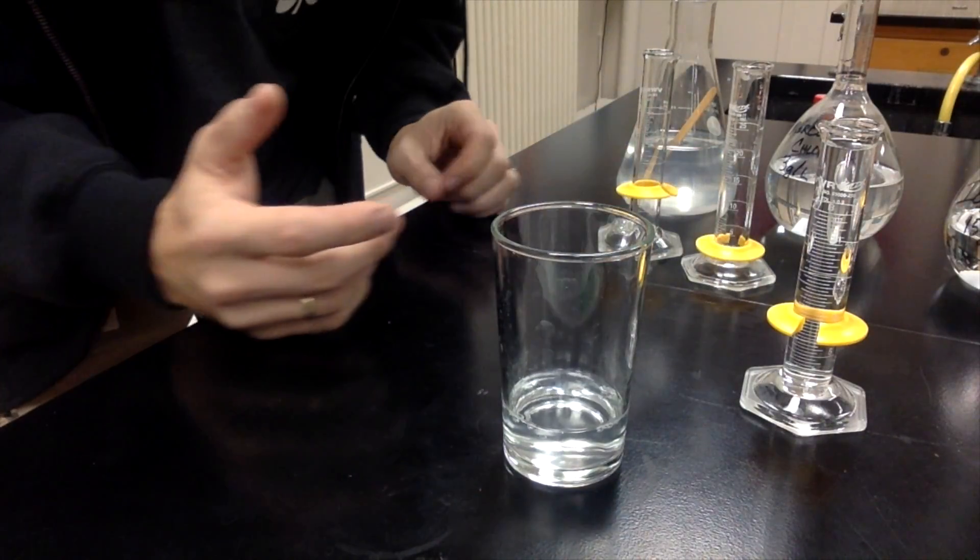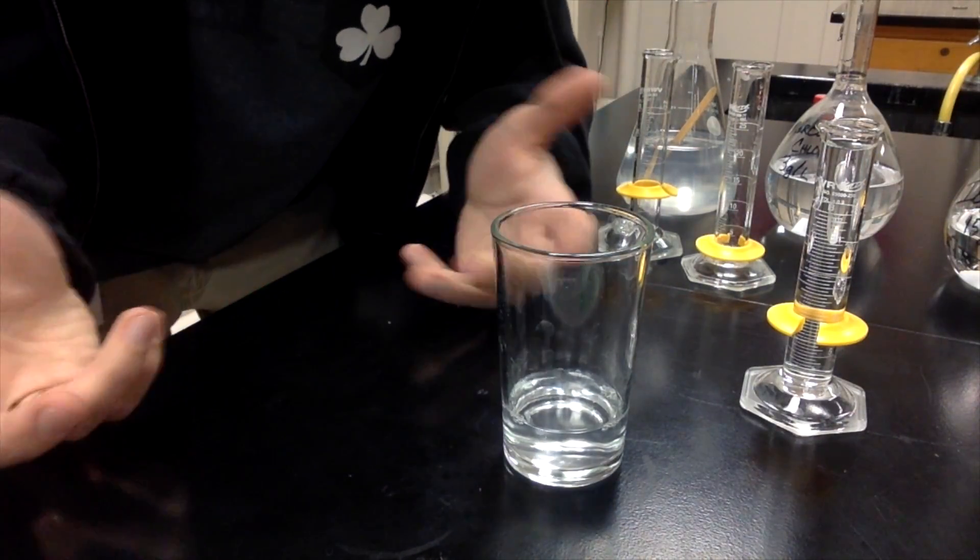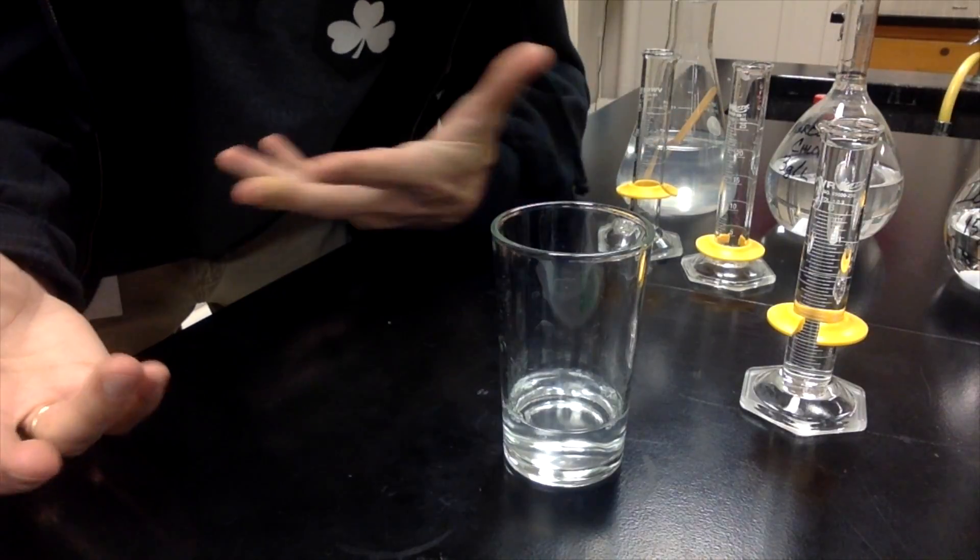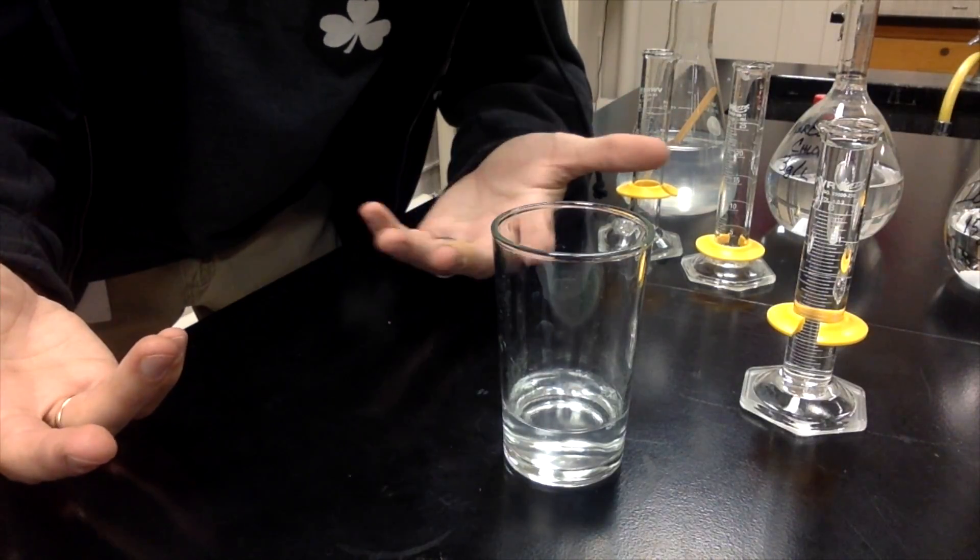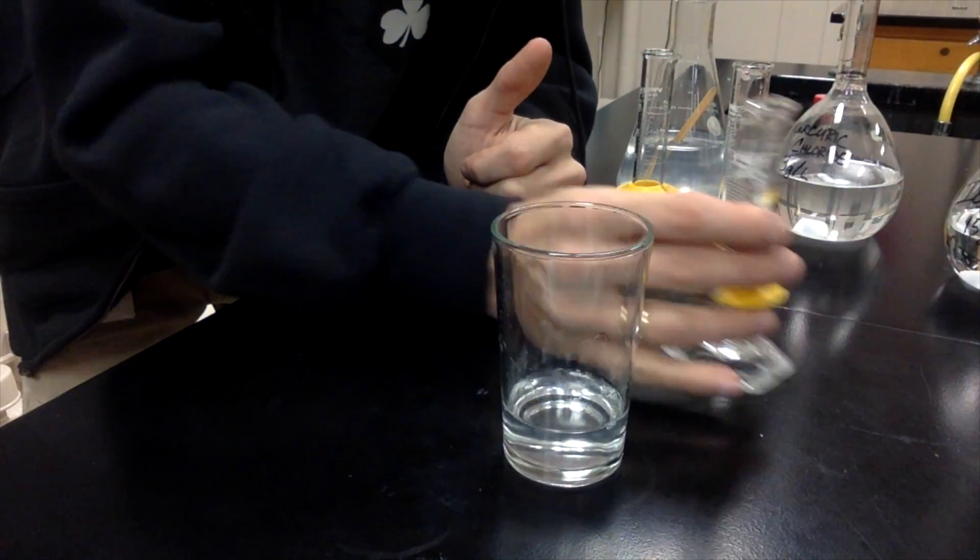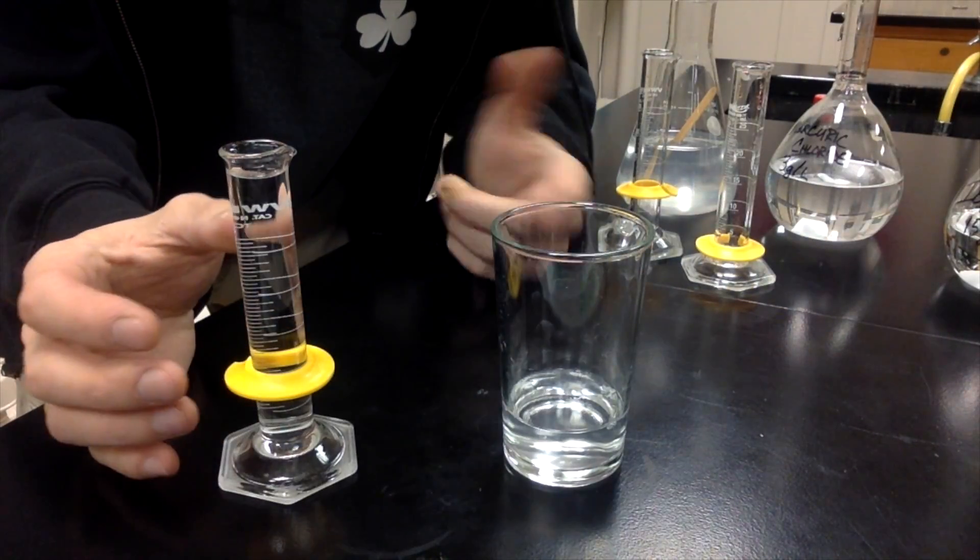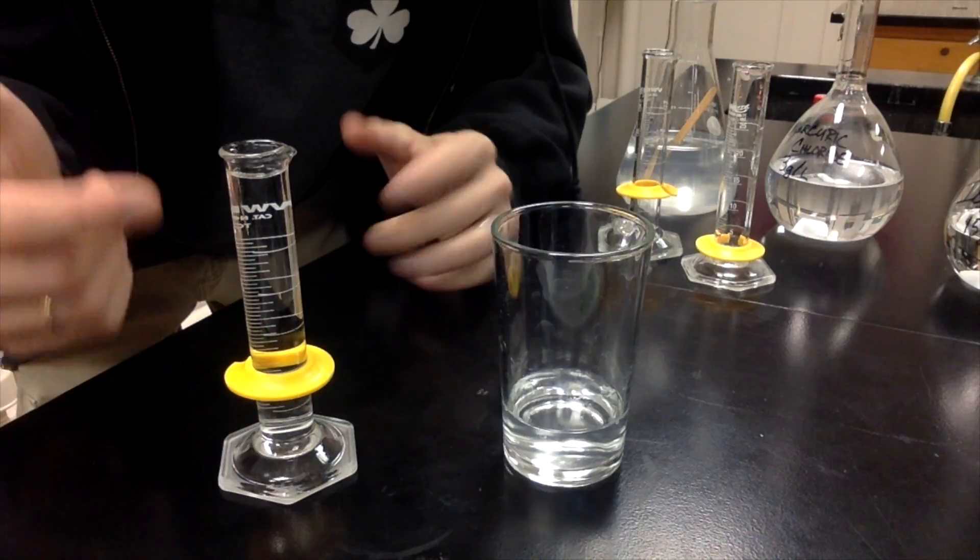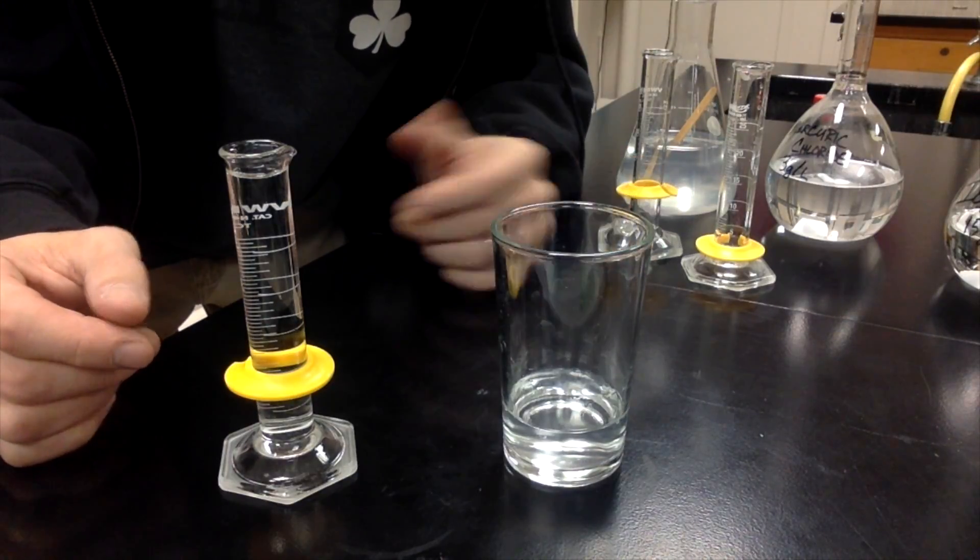I'm just kidding, I like to build a little hype. At this point kids seem to think that stuff's gonna blow up. Anyways, we put it all in there and nothing really happens. But once I mix in this last solution, this is our potassium iodate. I've noticed that it takes a little bit more of this to get things to work out quite right.